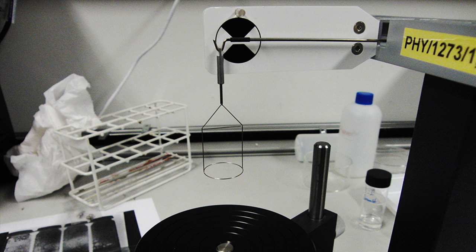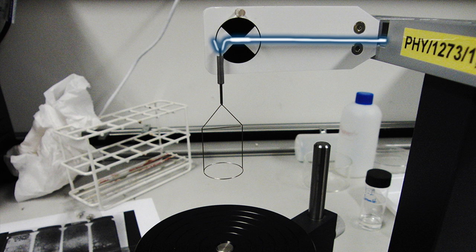Taking a closer look at the mechanism itself, we see the arm under tension and the ring.